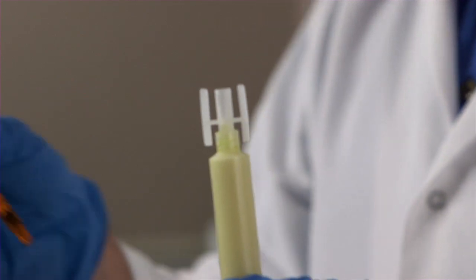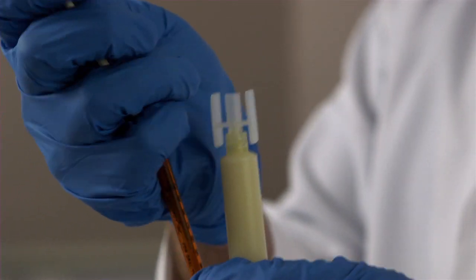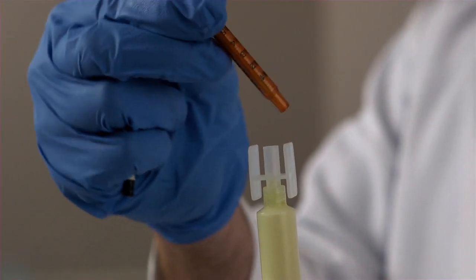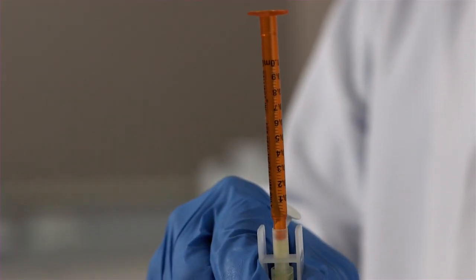We'll take our oral amber syringe, remove the plunger, replace the syringe into place. It's perfectly fitting. And you push the cream so it just peaks out the back.